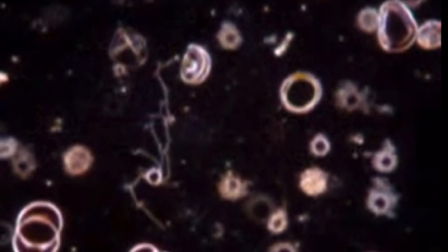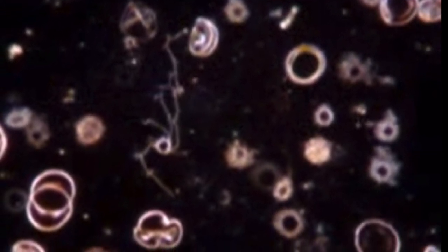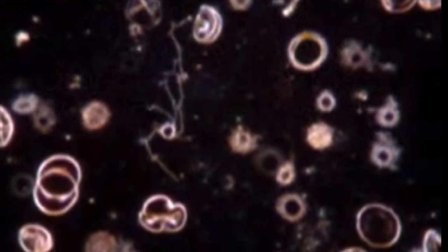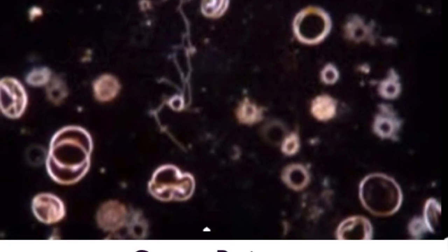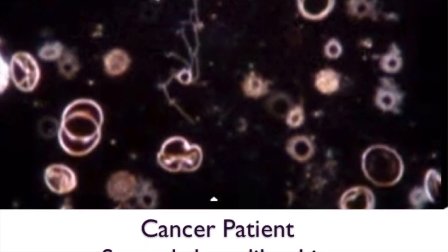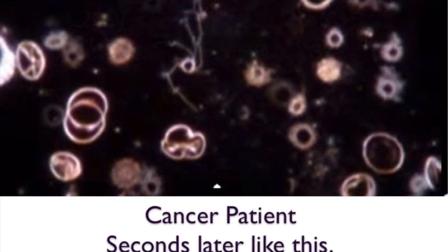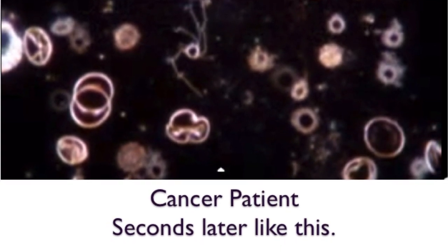Bacteria and microbes can be visualized but not identified. Emphasis must be made that PCR testing is the best method of identification of microbes. Visualization of microbes through live cell analysis is not conclusive, as microbes are pleomorphic and change their shapes outside of their preferred environment.